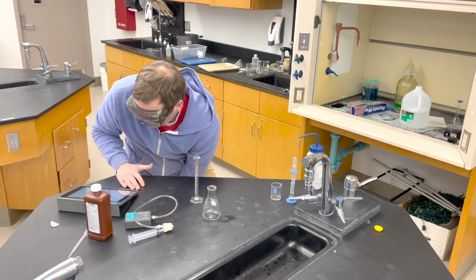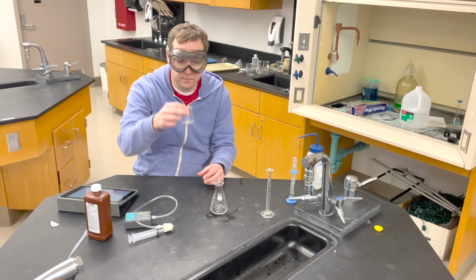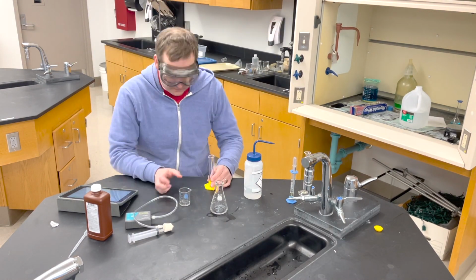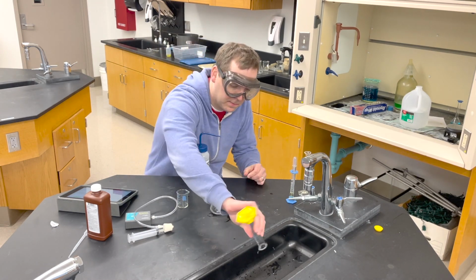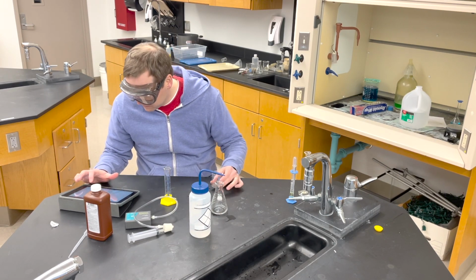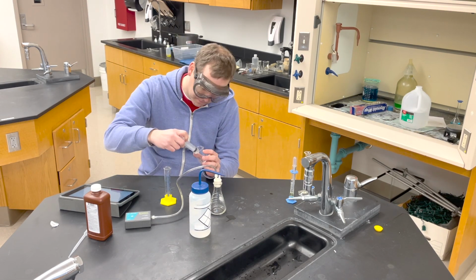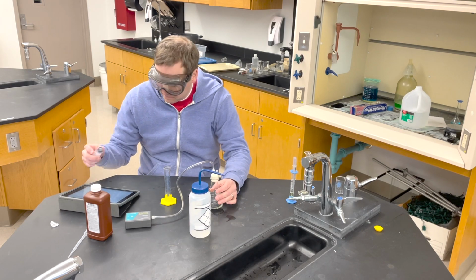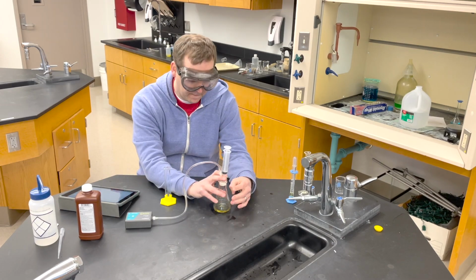So I measure out my 8 milliliters of hydrogen peroxide just like before, and I delivered it to the Erlenmeyer flask. This next part though is I measure out 2 milliliters of the potassium iodide solution, and this time I add it in with 2 milliliters of distilled water. Now that I've got 4 total milliliters, I can then draw half of that out and put it in with my hydrogen peroxide and mix those together. So here I go, I'm going to draw out 2 milliliters of the diluted solution. I'm going to mix them together, push the plunger, stir, and wait for 120 seconds, collecting data once again.